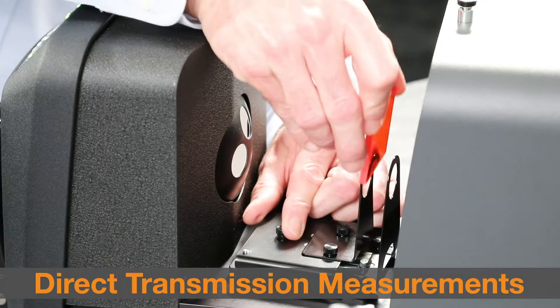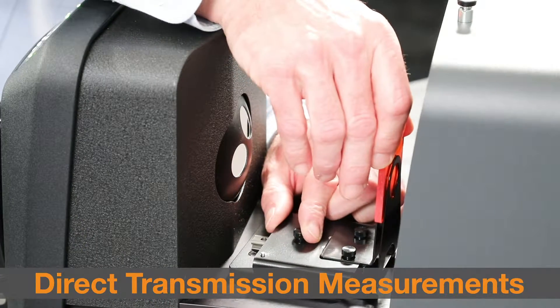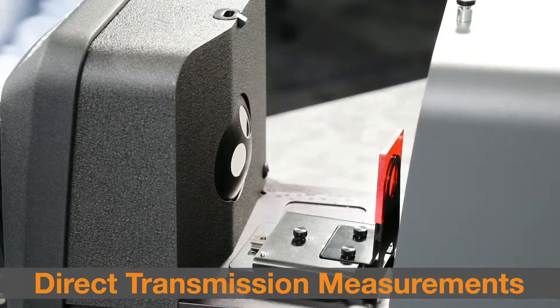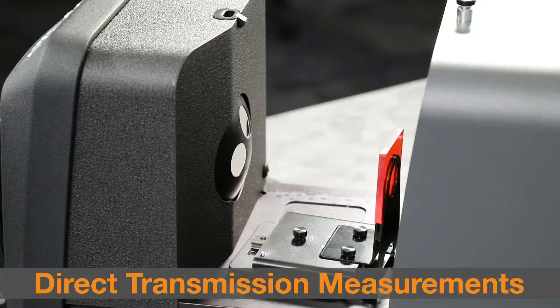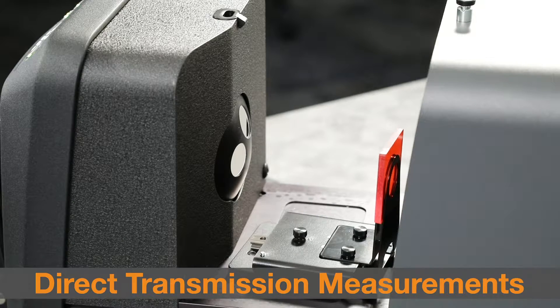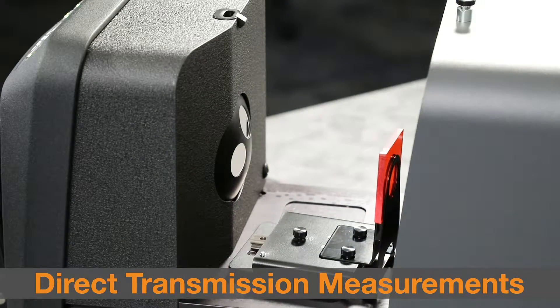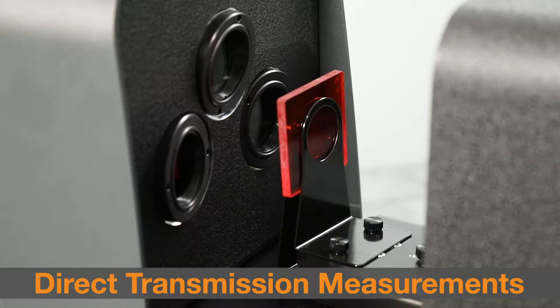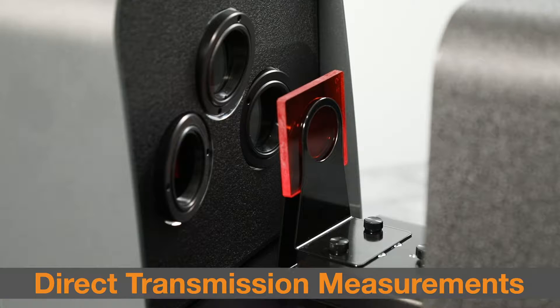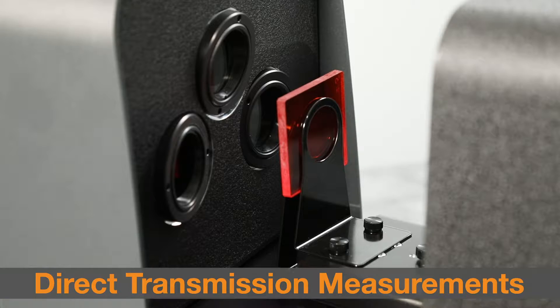Direct transmission is appropriate for measuring transparent samples which exhibit no scattering of light, such as samples colored with dyes rather than pigments. These measurements are taken with the sample positioned towards the lens in the back of the instrument.